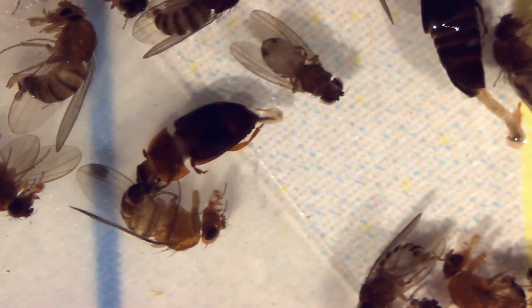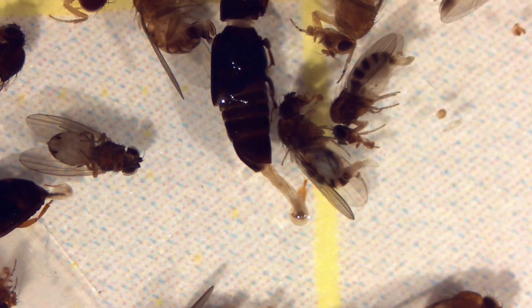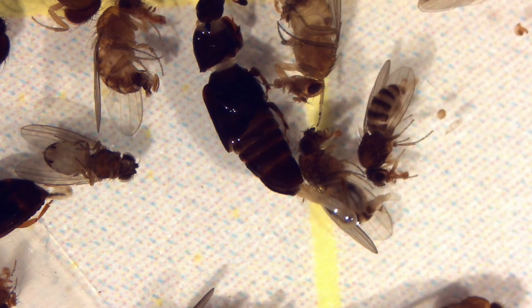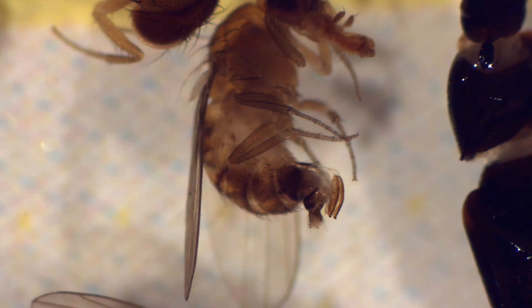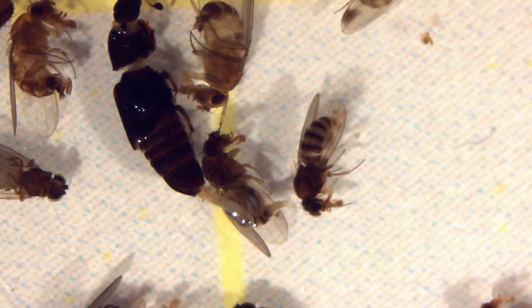Again, male to her left. Next to that beetle, that's a female on the left — right there. And that's a male on the right. So a female there, then that beetle, and then the male's on the right.